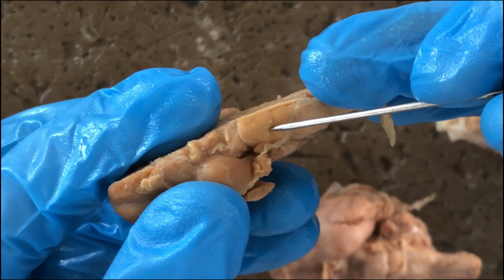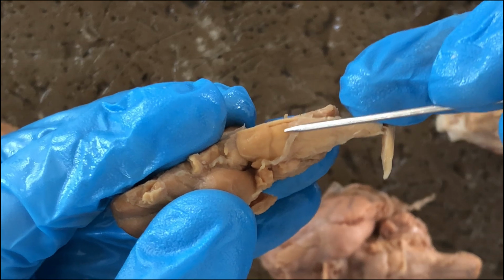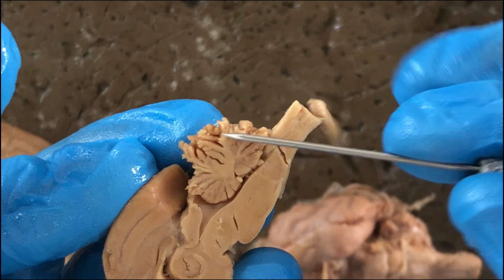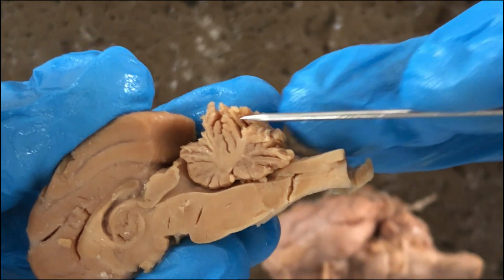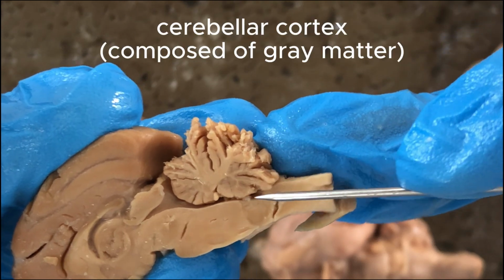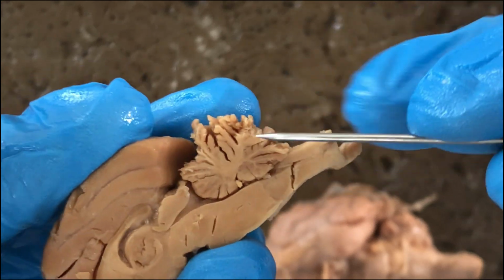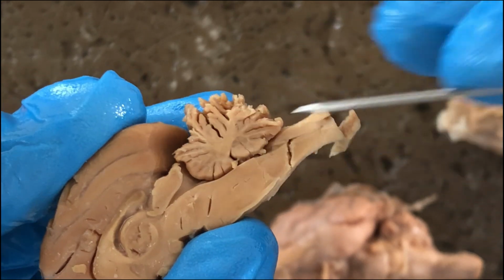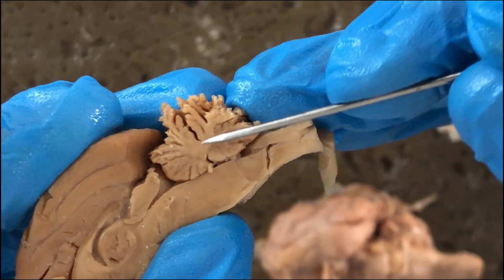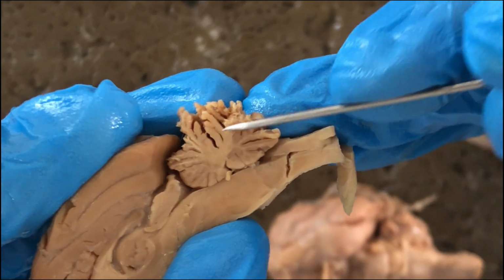And this would be the pons, cerebellum, and then trapezoid body. You see the median sagittal section of the cerebellum reveals its gray matter called the cerebellar cortex, and then the white middle portion would be its white matter. But it has a fancy name because of its tree-like appearance. The white matter of the cerebellum is called arbor vitae, literally tree of life.